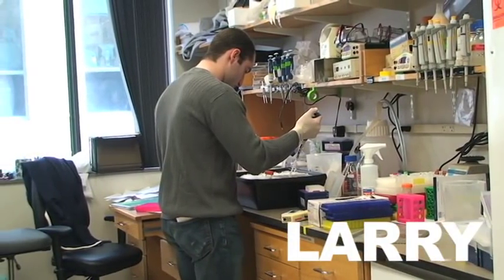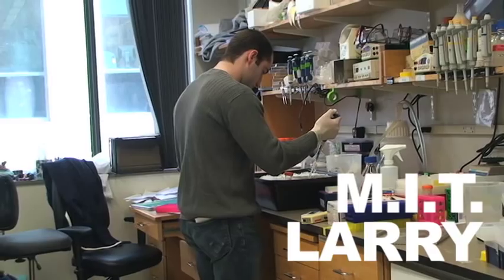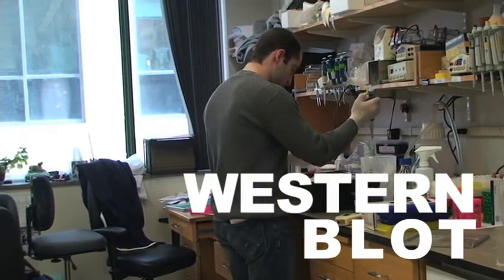This is Larry. He's a grad student in the biology department at MIT, and he's going to show us how to do a Western blot from beginning to end.